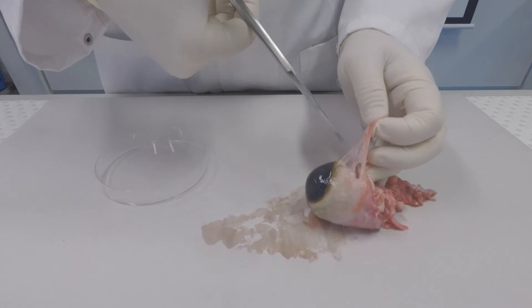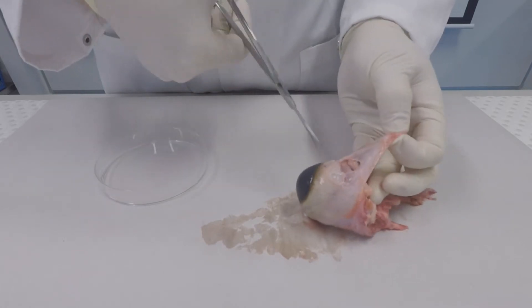I'm just removing some of this fatty tissue to expose the sclera.